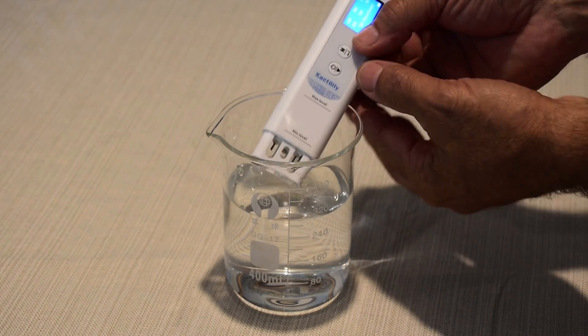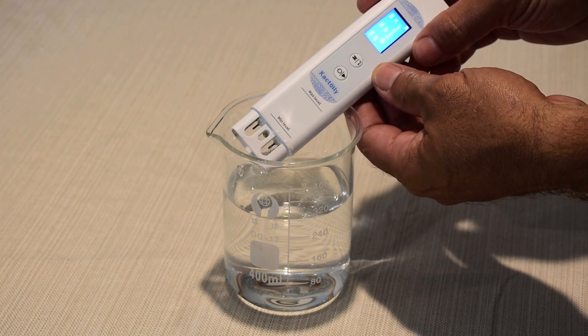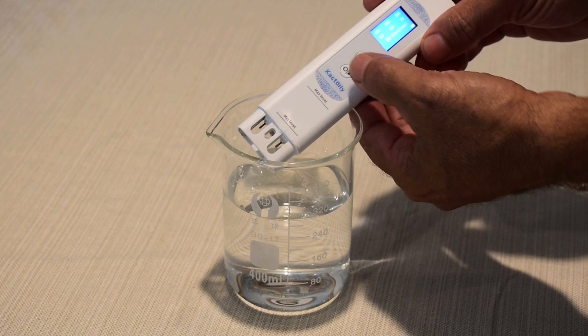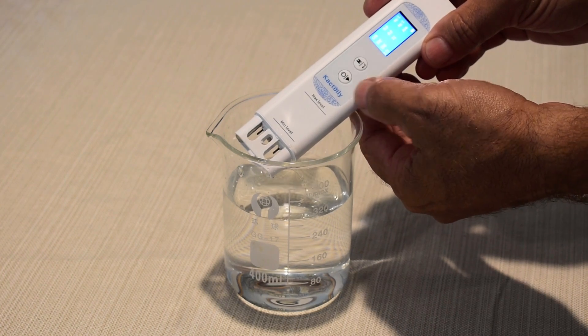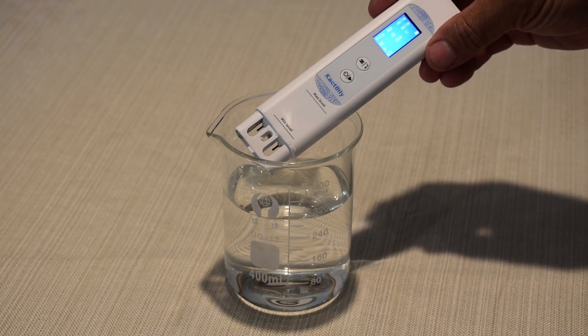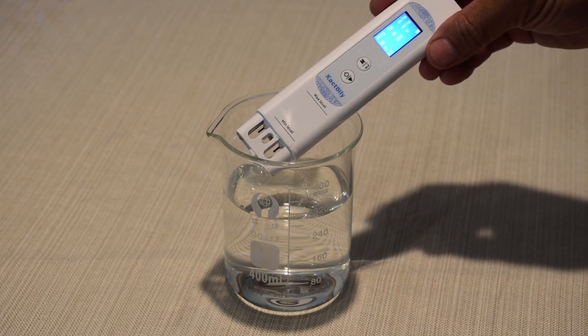Now the last one is going to be Alpine spring water Crystal Geyser. 99, excellent, and this is from the dollar store. COD is zero, TOC is zero, TDS is 31, zero for the UV-275, EC is 61.